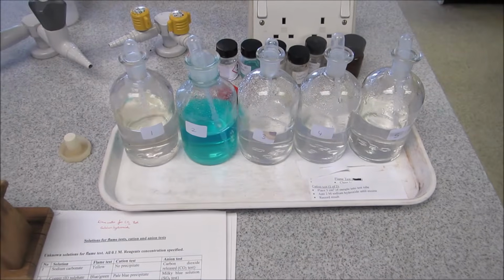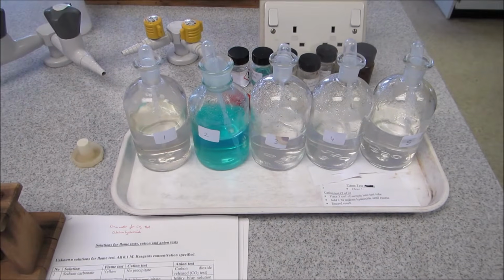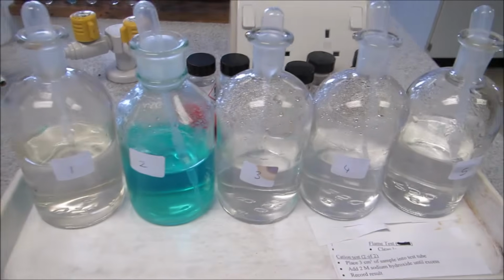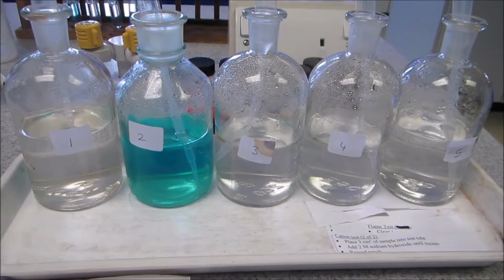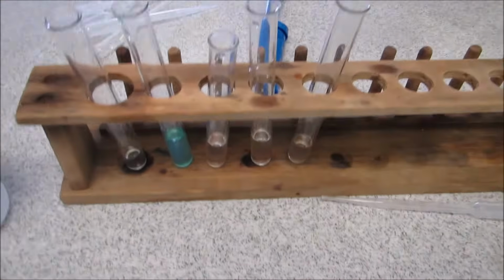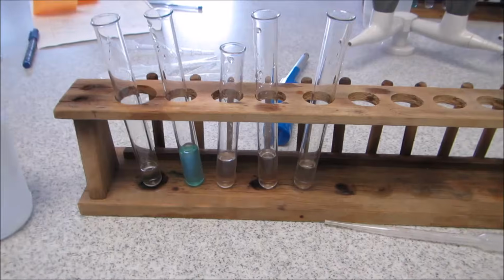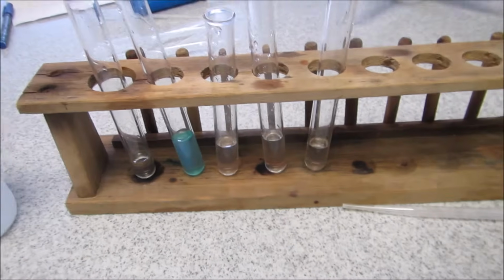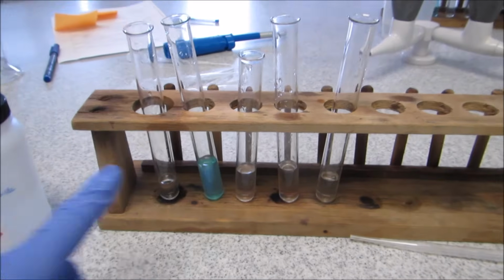So you can see my video on doing cation, anion test and flame test, and then you could be presented with unknown solutions. So here I have 5 different unknowns, and I want to use a combination of cation, anion and flame test to work out what each salt is.